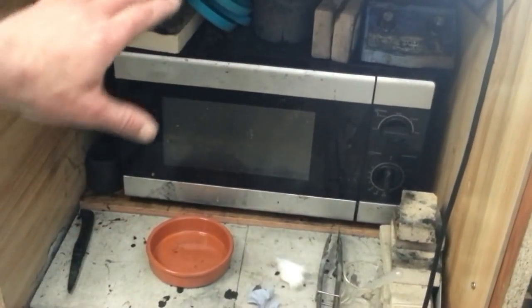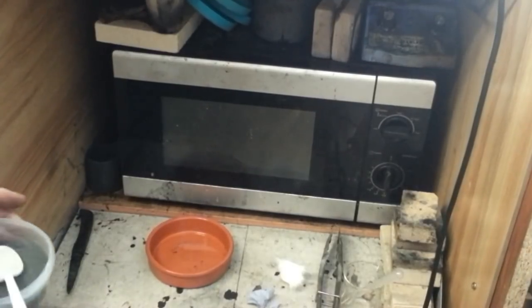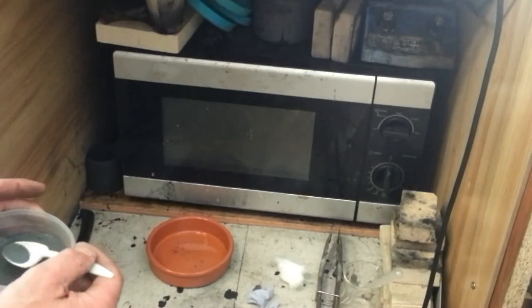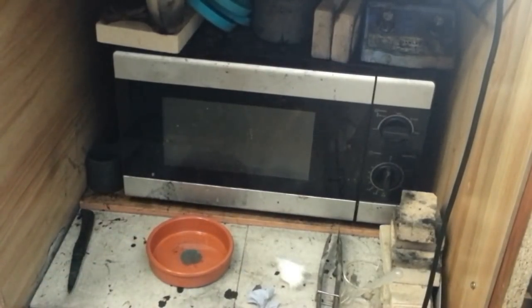As you can see, we're underneath my fume hood, which is where the microwave is. So what we need for this reaction to take place — as we use when we're making the graphene oxide — one component is potassium permanganate, and the other component is sulphuric acid.